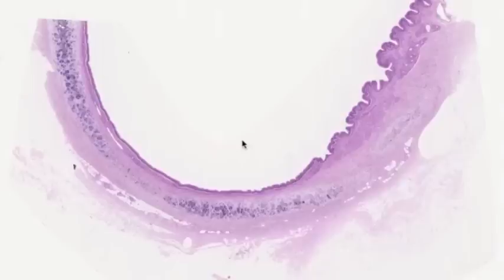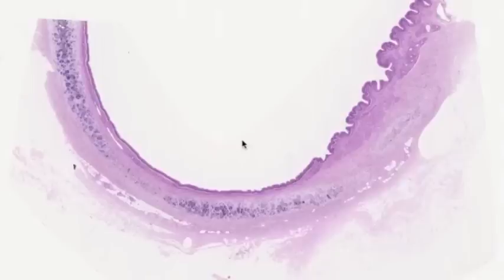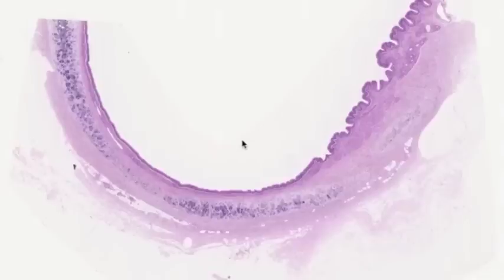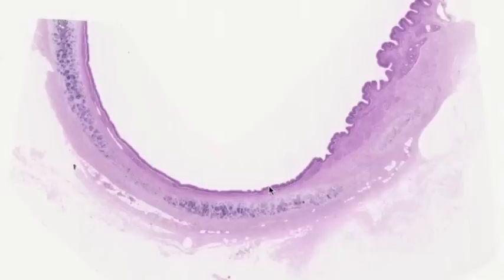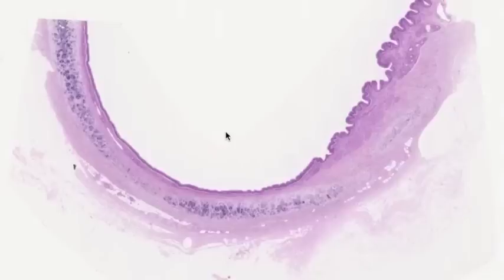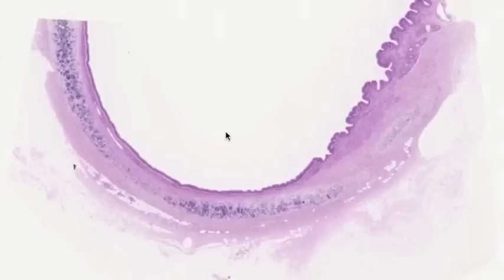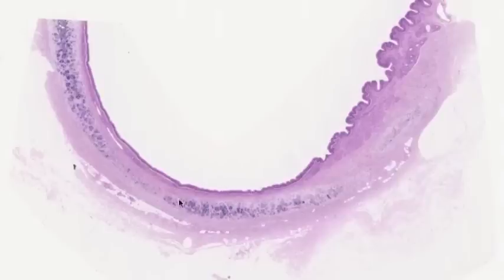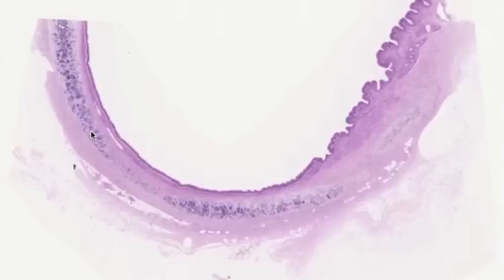In this clip we're going to look at the conducting portion of the respiratory system, beginning with the trachea. Here we see the lumen of the trachea through which air passes. The lining is a pseudo-stratified columnar ciliated epithelium with goblet cells, also called respiratory epithelium. The giveaway feature of the trachea is this respiratory epithelium overlying hyaline cartilage, because the wall of the trachea is reinforced with C-shaped rings of hyaline cartilage.